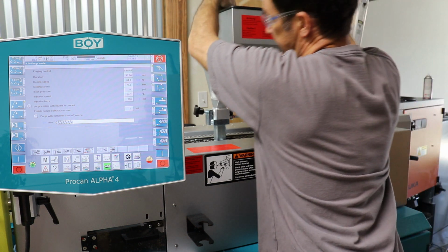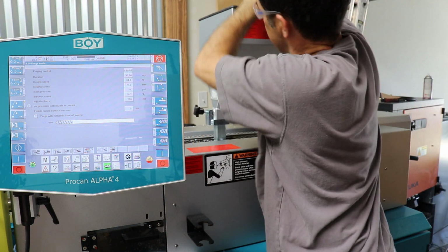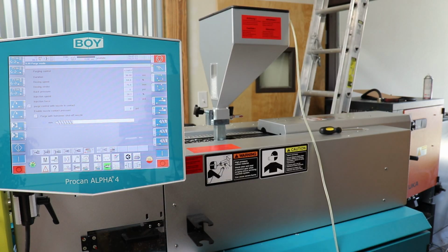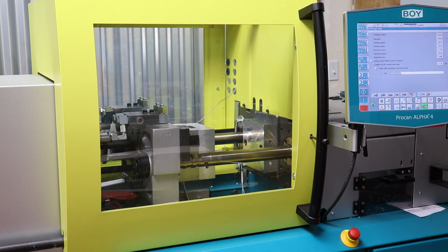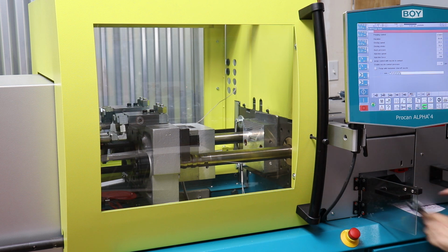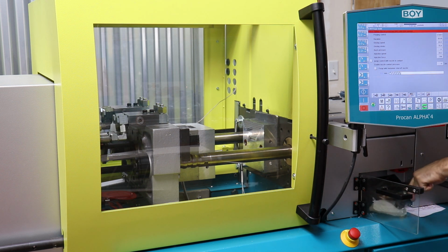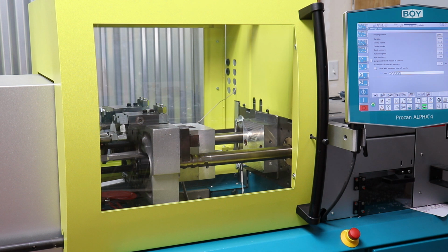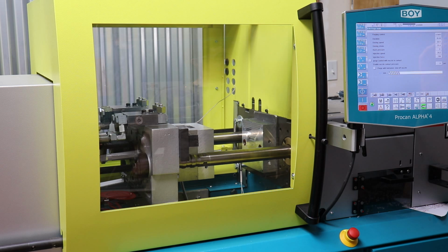So I'm gonna stick this guy in here, get the hose as far down to the bottom of the hopper as possible. Where is that lid? Oh, here it is. I'm gonna clean out the purge plastic that's in here, making sure not to touch it with my hands, because it'll burn you good. I usually just throw it down on the floor. But if it stinks, then I'll take it outside and throw it in the dumpster, or run cold water over it to cool it off.